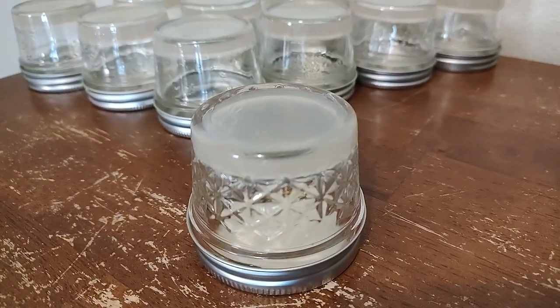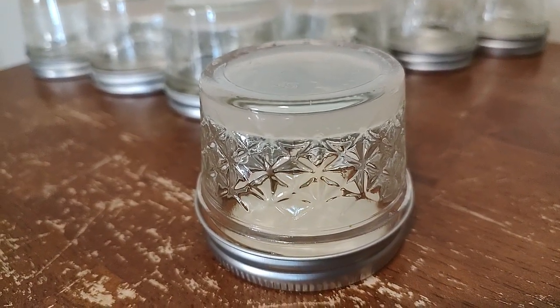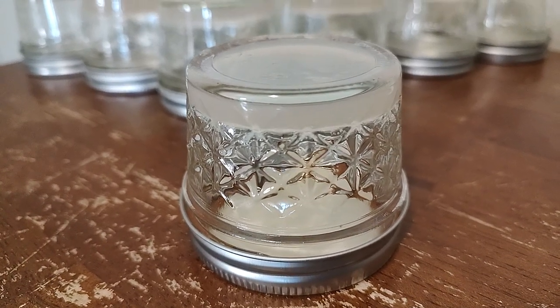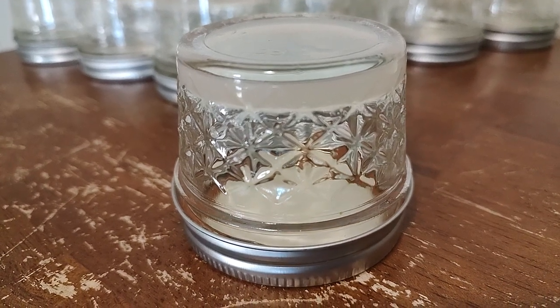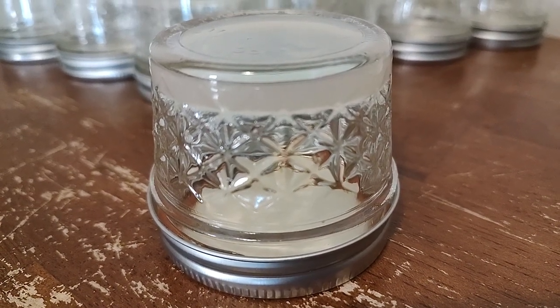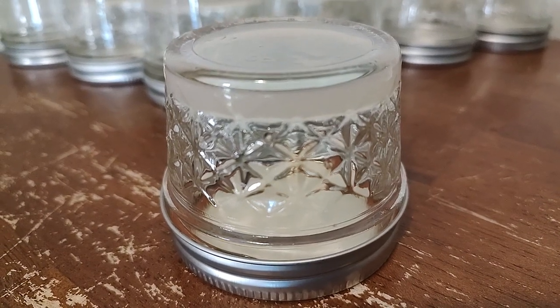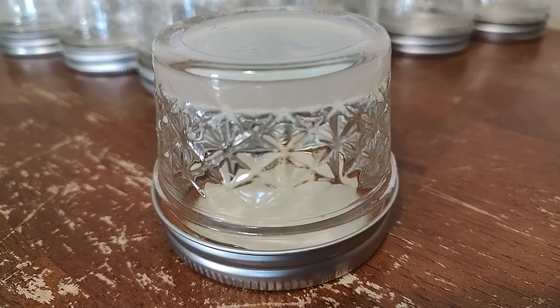This is an incredibly light MEA agar recipe that the husband is experimenting with. That's what we're doing in these colder winter months — experimenting and sharing this with you. I'm going to have another video about this very light MEA process with cloning mushrooms, but for this video, let's keep talking about the flipped lid.